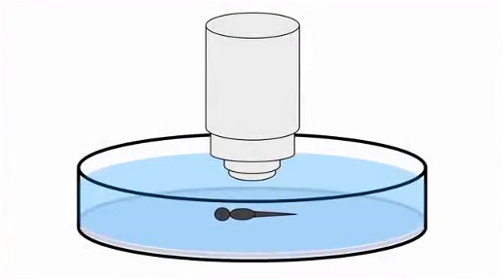In long-term time-lapse experiments, it is common to observe sample movement. This can be caused by slight inaccuracies in the hardware controlling stage and focal positions, while in other cases, drift is a result of movements induced by sample growth or flexibility within the mounting media.